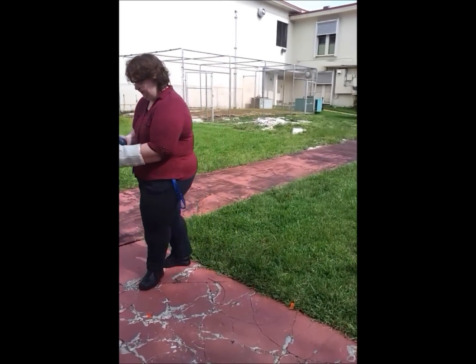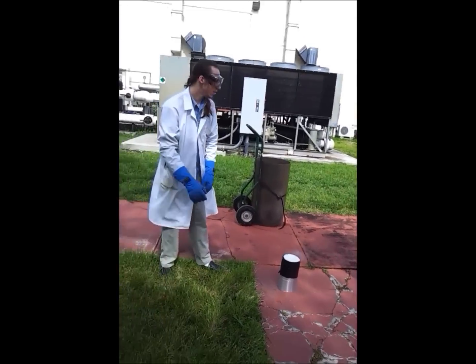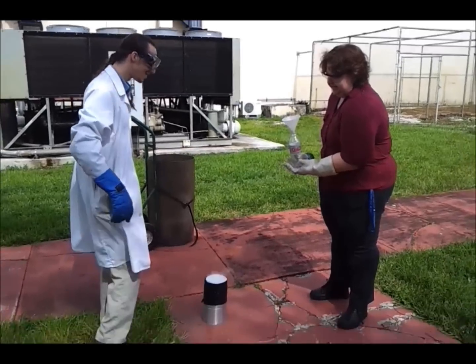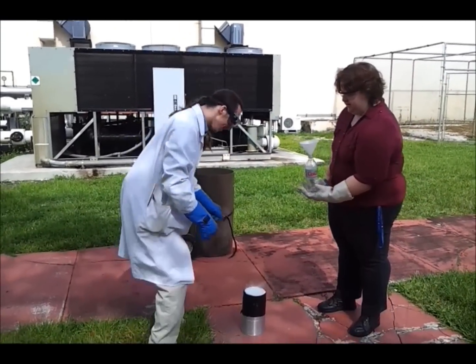So we're going to fill this up. Wait a second — I just had to get the cap out. I don't need it, it's all open.